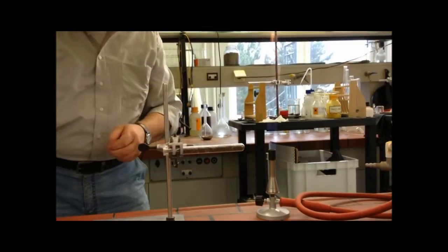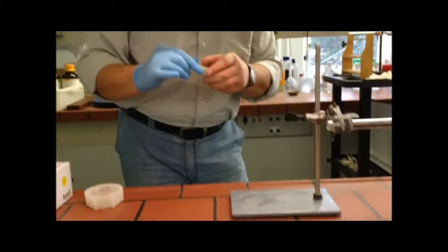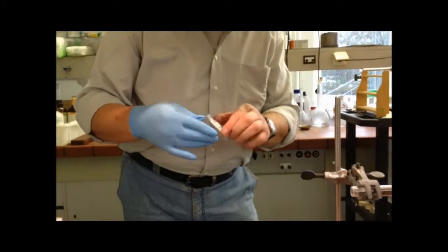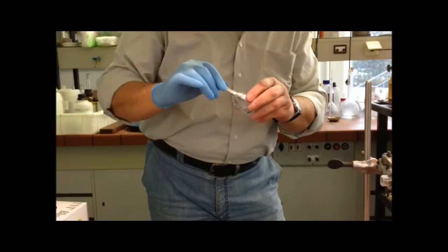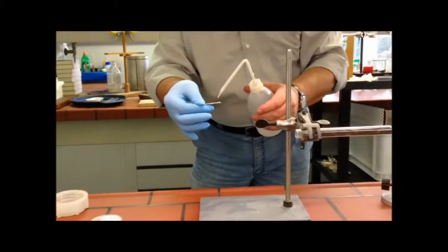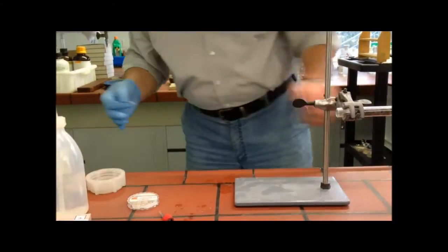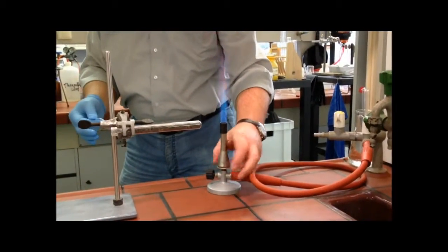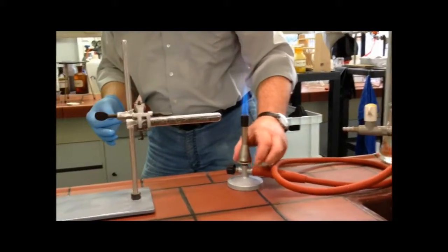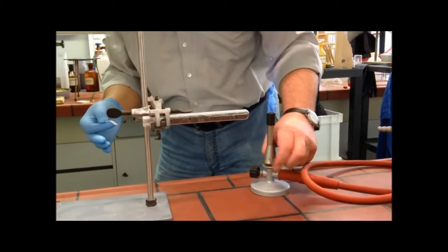On the Bleiacetat-Papier there is a hazard symbol — a skull and crossbones. One should not touch it with bare fingers, hence the rubber gloves. I tear off a small piece, add some water to it. Because unpleasant-smelling substances are produced, I also turn on the fume hood.